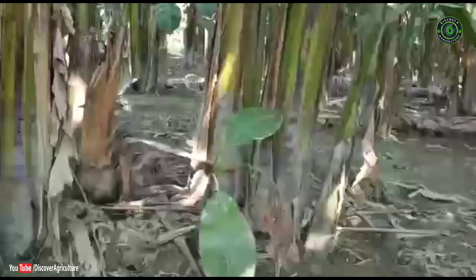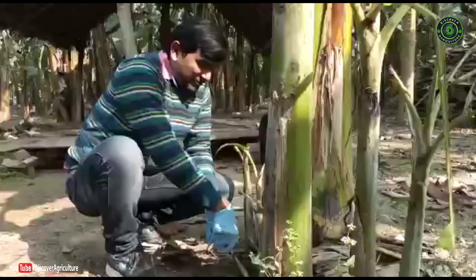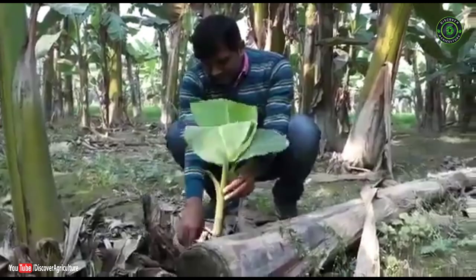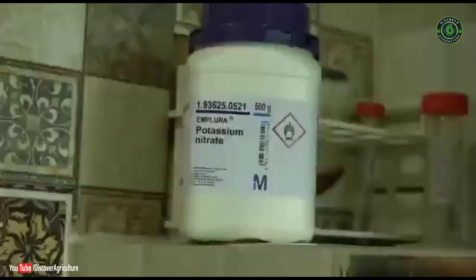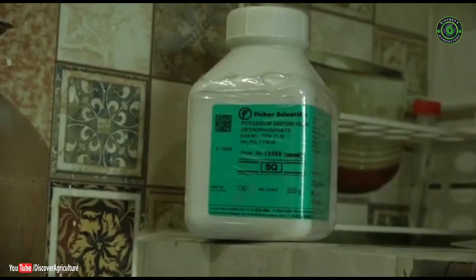For selection of mother plants and standard requirements for a mother block nursery: while collecting suckers of banana, we should collect sword suckers which are 50 to 60 days old. Water suckers are avoided because they are not healthy and cannot be propagated. The success of in vitro culture depends largely on the choice of nutrient medium, including its chemical composition and physical form.